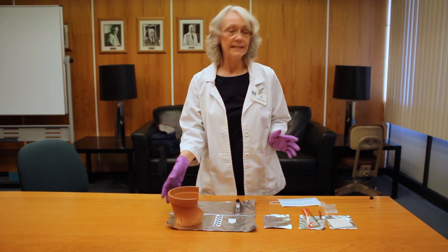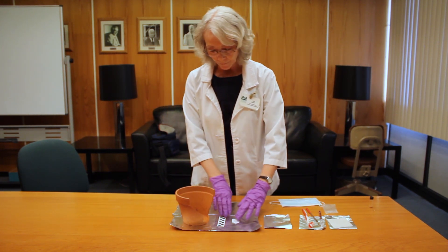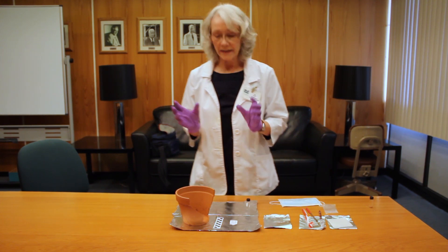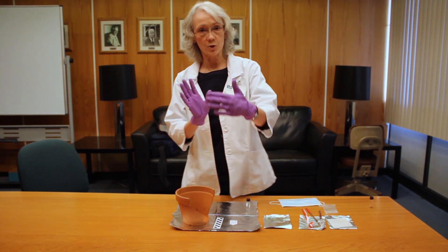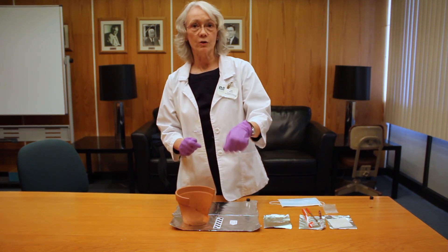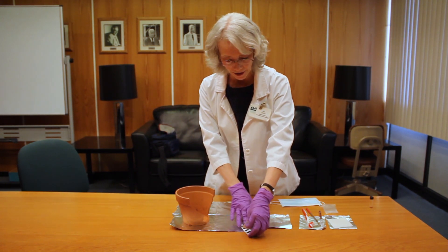Start by taking a photograph of the object — I have my broken Walmart flower pot here, just with a little label. Take a couple shots of it, and in particular pay attention to get a good shot of the area that you're going to be sampling, so you have a before shot. Then at the end take an after shot of what it looks like after you've sampled it, just for documentation purposes.